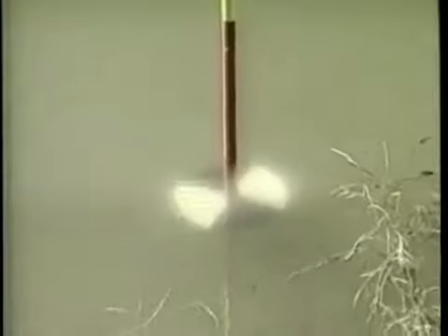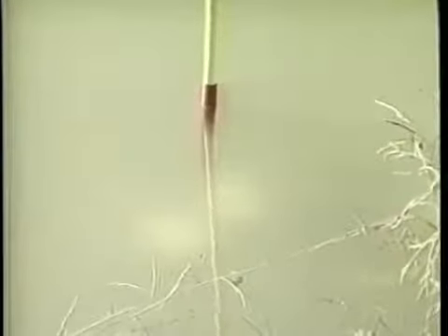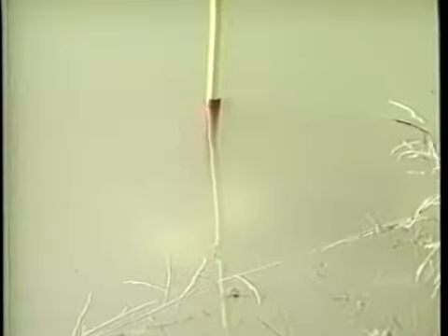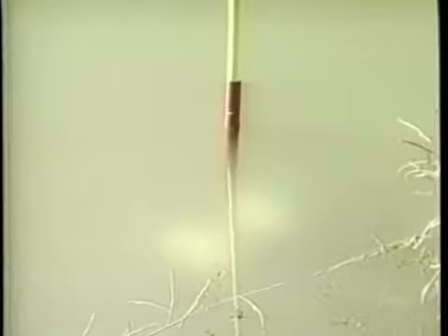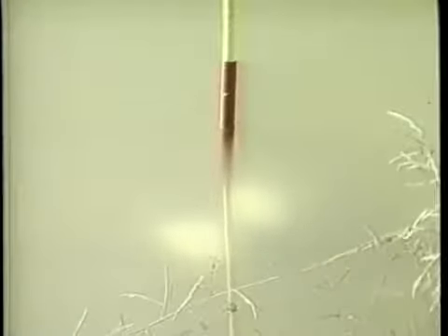To obtain the Secchi disc visibility reading, the disc is lowered into the water until it just disappears and the depth is recorded. The disc is then lowered a little deeper and then raised until it just reappears. The depth at the reappearance of the disc is also recorded. The average of the two readings is the Secchi disc visibility. Conditions for obtaining the Secchi disc visibility should be standardized. Measurements should be taken around noon or early afternoon on calm, sunny days.